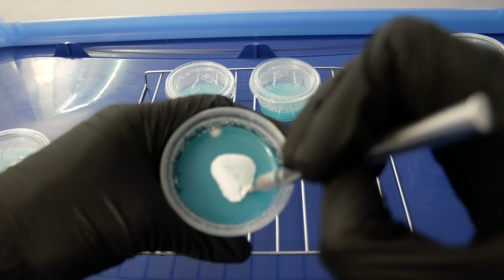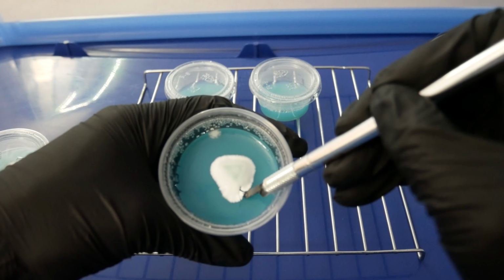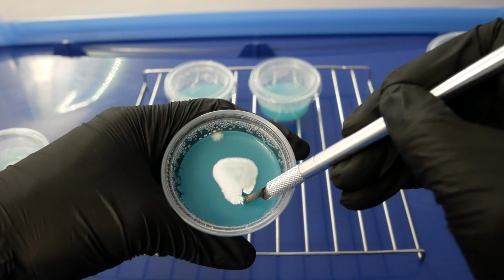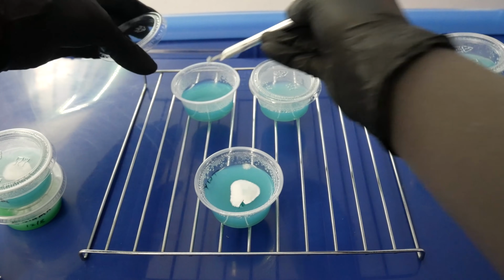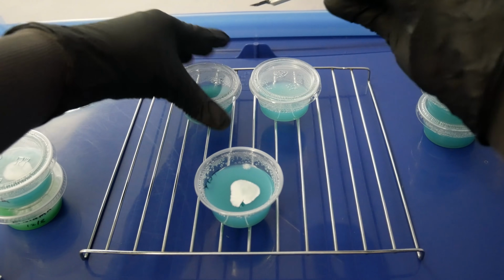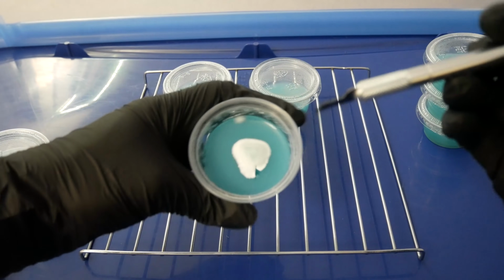So here I'm selecting a part of the mycelium that's furthest away from the weird spot that I see at the top here. You don't really need a whole lot of mycelium. Smallest little speck is enough to create growth. Here I'm going back in.